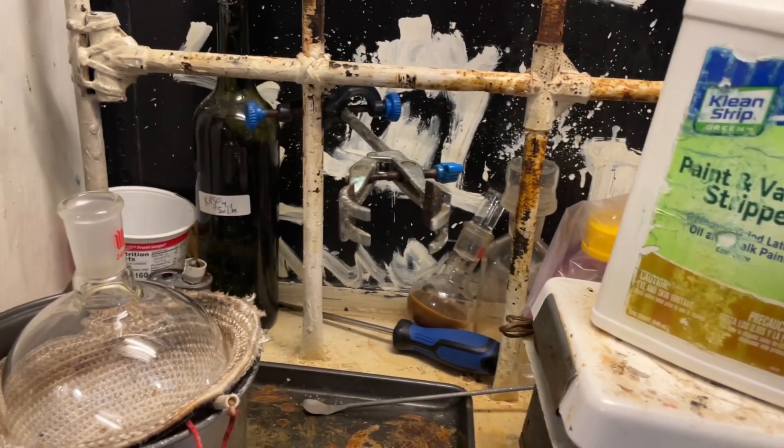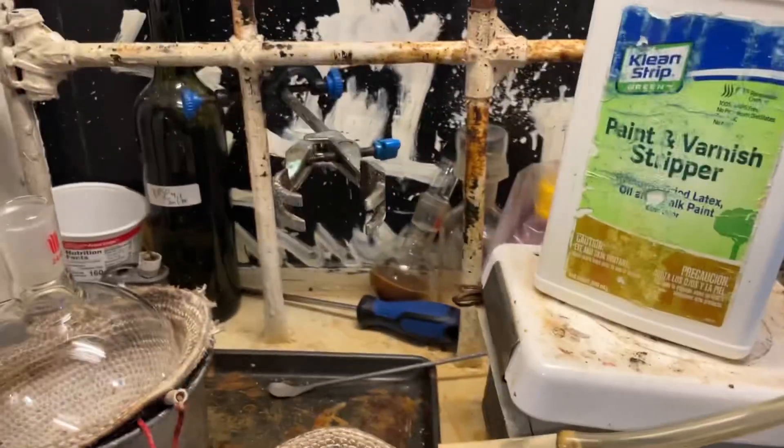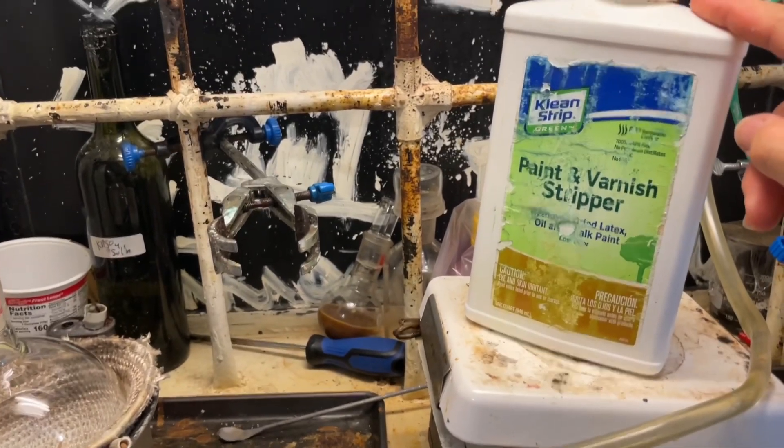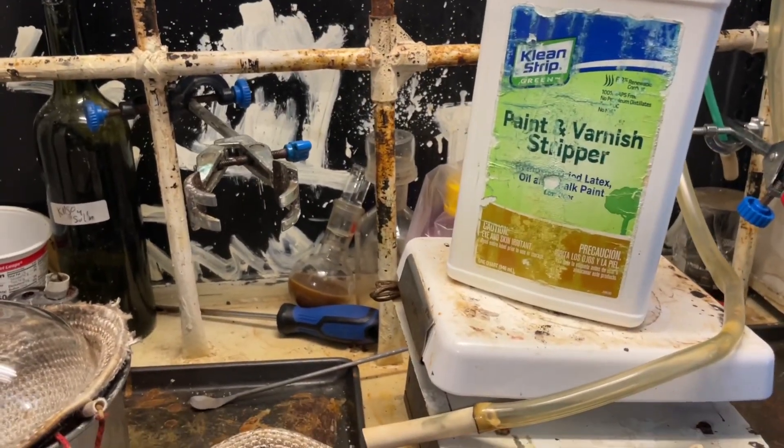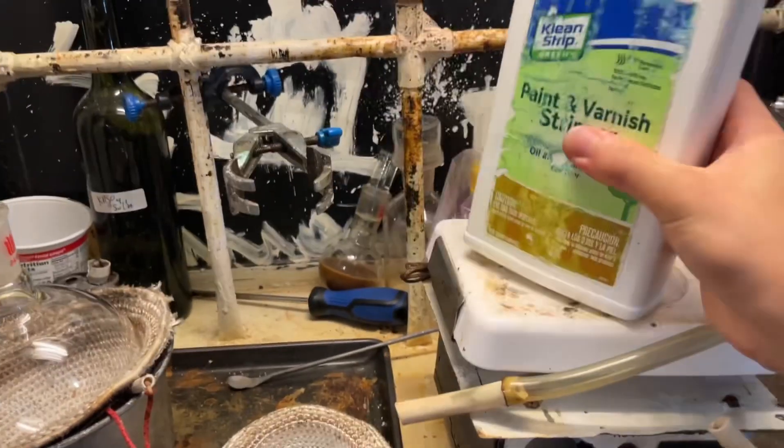Welcome back everyone, and in this episode we will be synthesizing benzaldehyde from this paint thinner here, or paint stripper, because it's actually not paint thinner, it's goo.